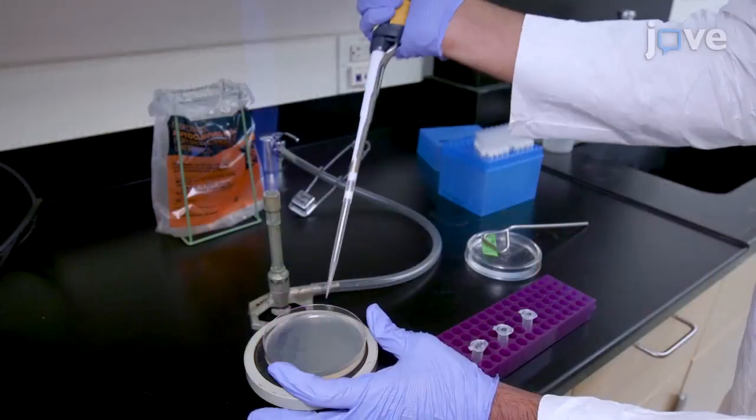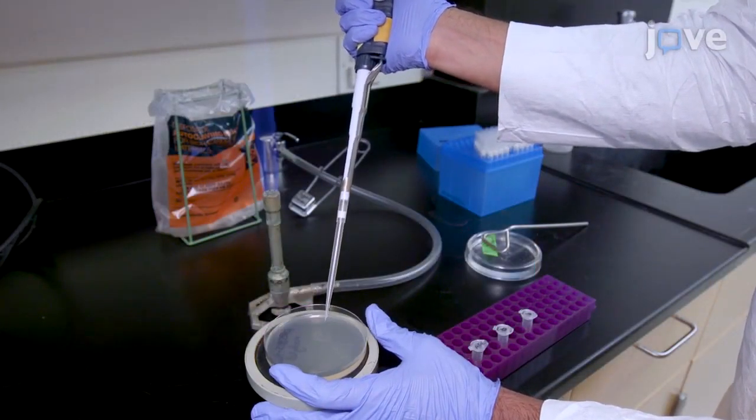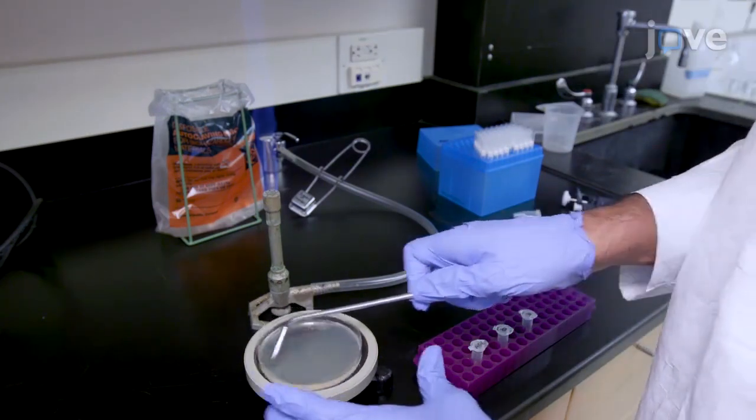These can be utilized to study several different aspects of aging, and we will be focusing on chronological lifespan, which is the duration that a cell can survive. The objective of this work is to provide a straightforward genetic approach to perform an overexpression suppressor screen.